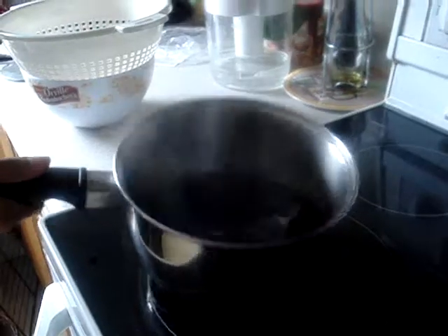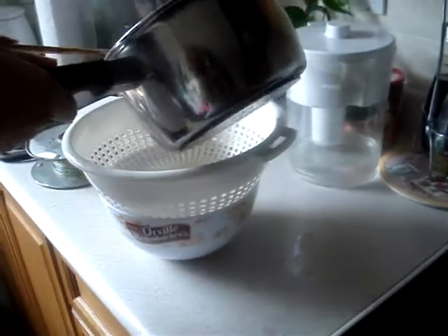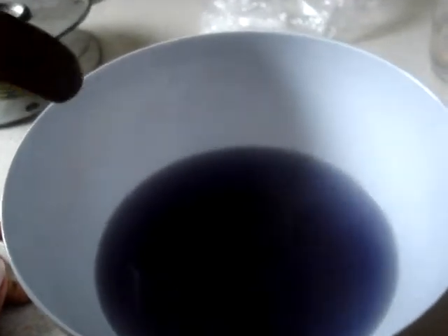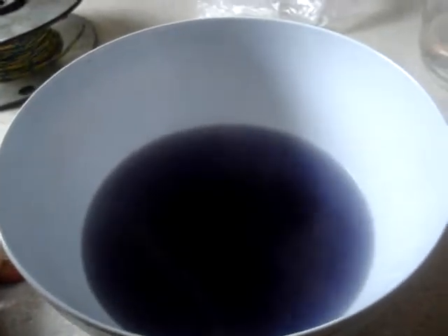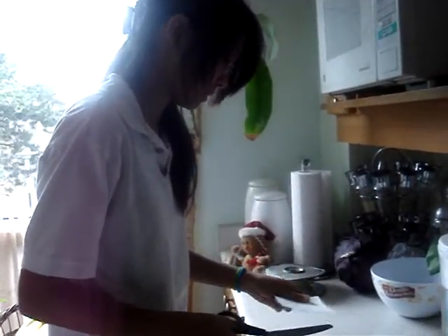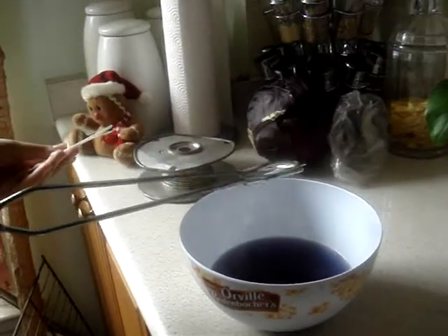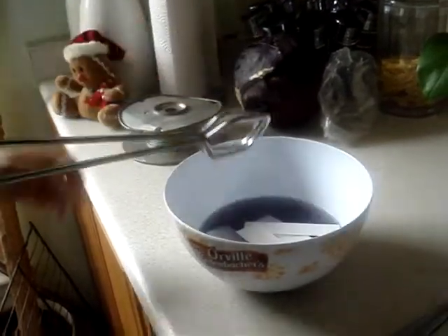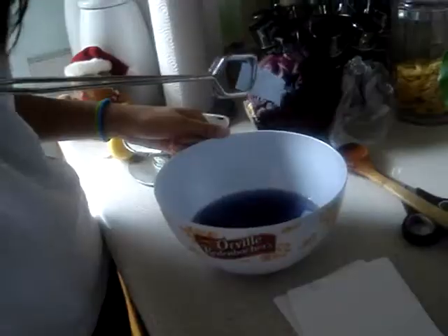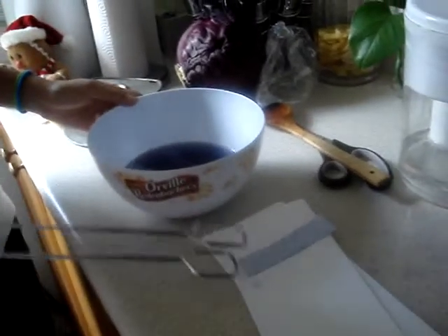As you can see, the water has turned purple. Now, take the pot and pour the water out, getting rid of all the cabbage. Now you can clearly see the purple color in the water. Now put the bowl away and wait for it to cool down. As you do so, you can cut the piece of paper into as many strips as you want. Put the papers into the water and wait for them to turn purple. Now you can take the pieces out and let them dry.